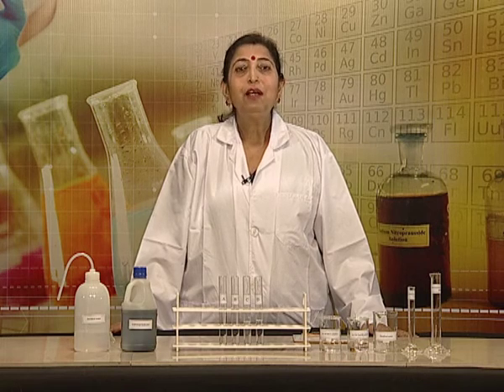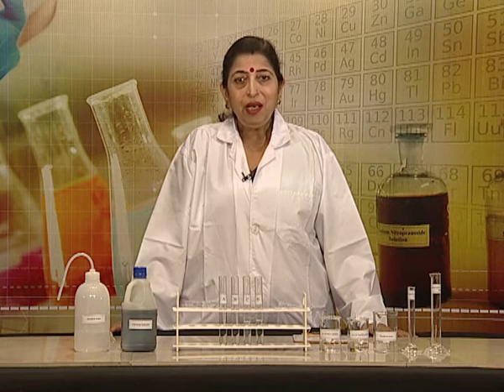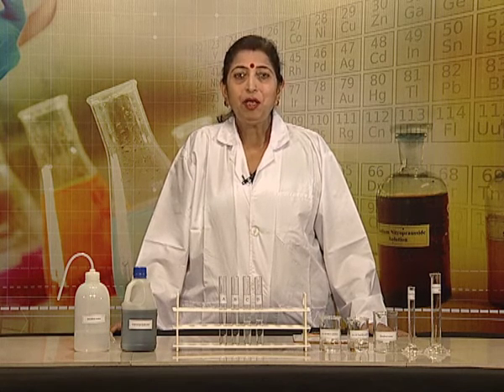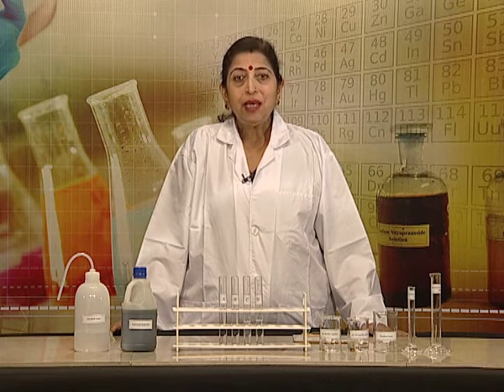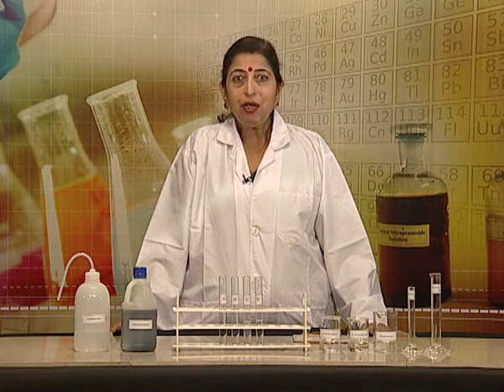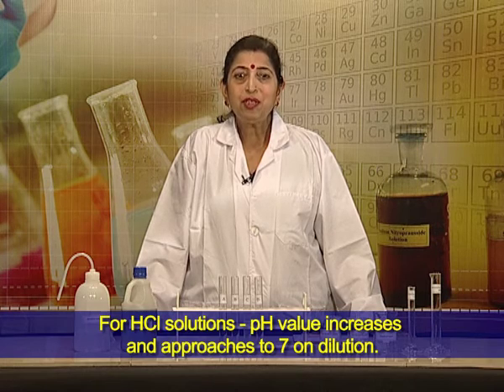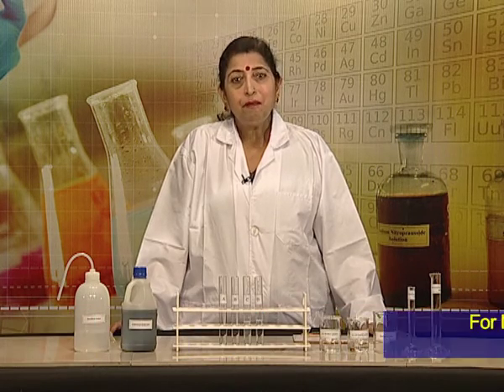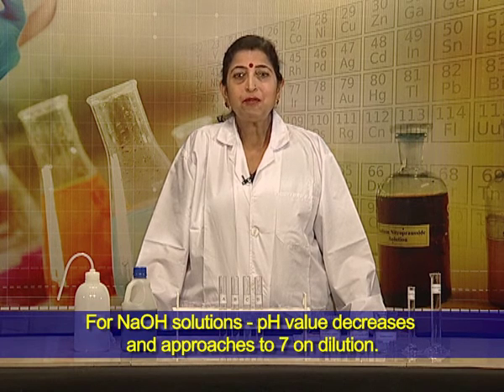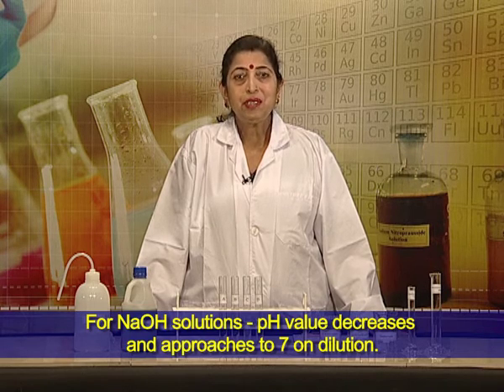Let us recall what we learnt from today's experiment. We learnt how to use pH paper to find out the pH value of a given solution. Second, we learnt that for dilution of an acid, the pH value increases and approaches 7. For sodium hydroxide solution, with different dilutions, the pH value decreases and it approaches 7.